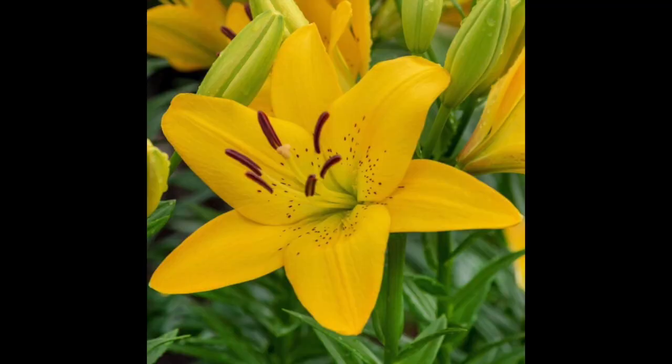A really good type of flower to look at, if you want to make sure that all of the parts are there and they're really big so that you can see them really easily, is different kinds of lilies. So think those big lilies that they sell in grocery stores that have 6 big petals. If you either grow those or you have them at a grocery store that you can do a pickup for, that's a really good flower to be able to see all those flower parts really big. But otherwise, just like I showed you, you can look at any flower and you can find some of those parts.